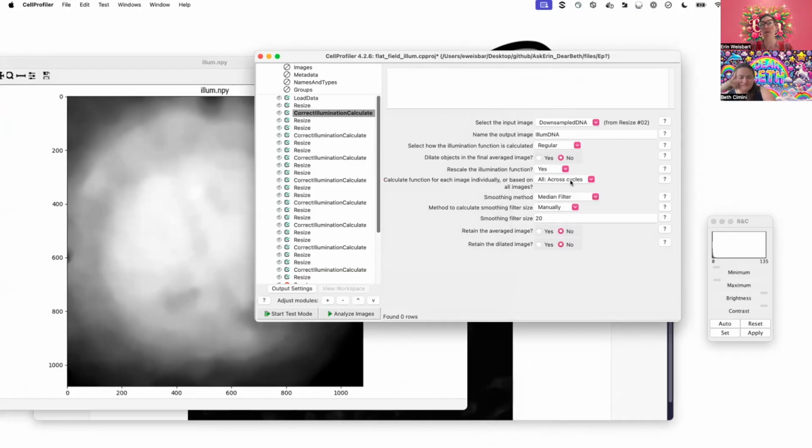And here, this other tricky part is whether to calculate a function for each image individually or based on all the images. Here, we actually want this to use all of the images across all of the cycles of what we have passed in. In this example, I have a load data where each row is a different image site, and I'm telling it I want it to use every image that was acquired on my plate in this channel to create this, rather than the other pipeline where we want to do it on an image by image basis. So this yes here is quite important. We would never want to not use that setting.